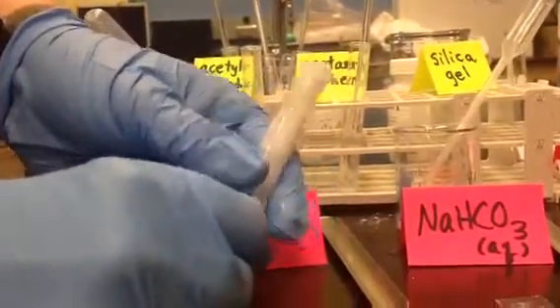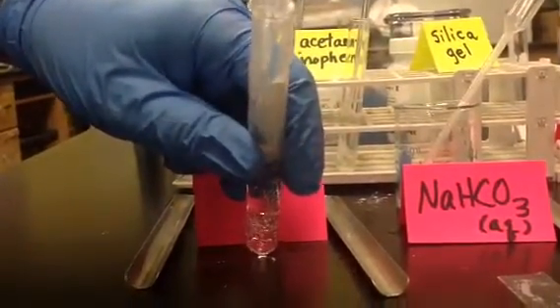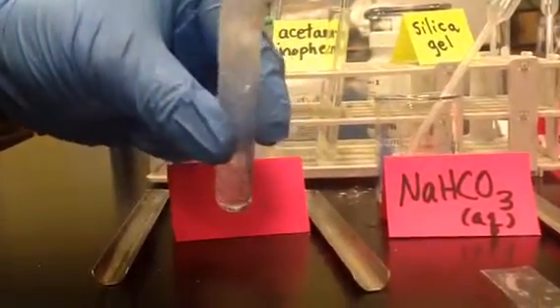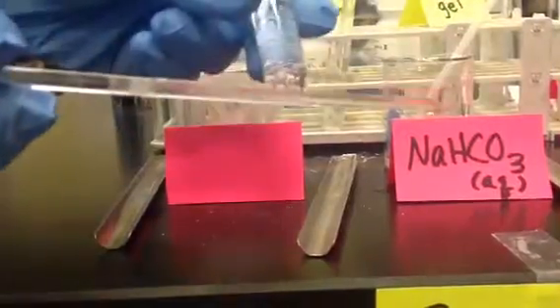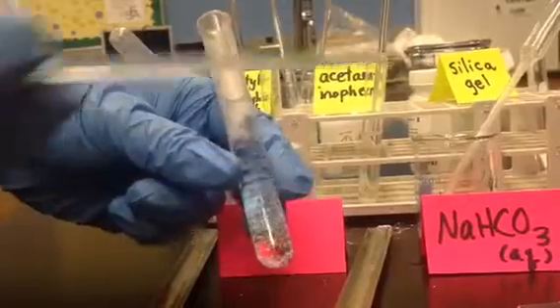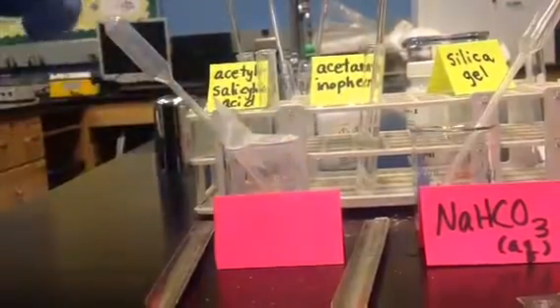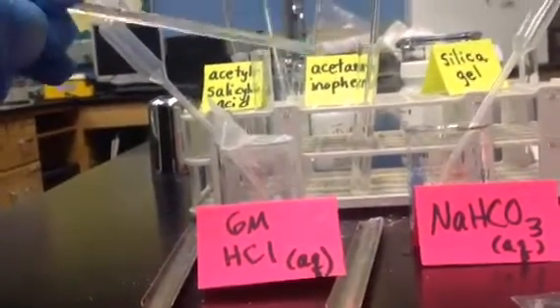But you can see the acid that recrystallized, and I'm going to push that back down in, or I'll just pull some of it out. That is the acetylsalicylic acid recrystallized once I added acid back into the solution. So definitely it was dissolved in the base, the sodium bicarbonate. As soon as I added 6 molar hydrochloric acid, what started happening? I precipitated the acid back out. So I can dissolve the acetylsalicylic acid in base, and when I want to recover the acid, I can add 6 molar HCl. And that's the introductory activity. And I'm Dr. Lagrone.